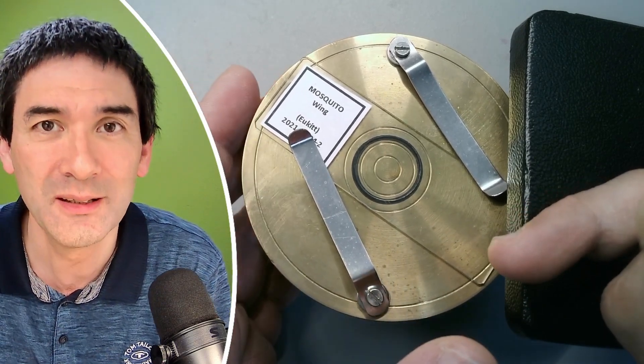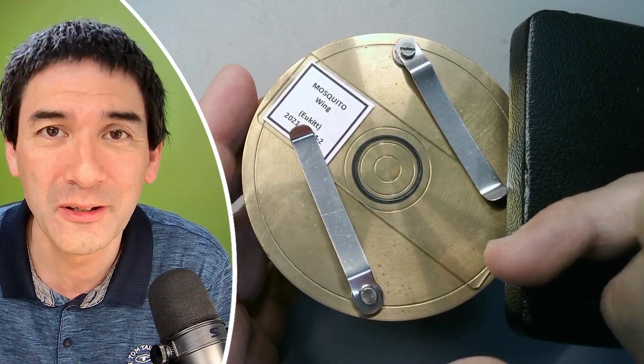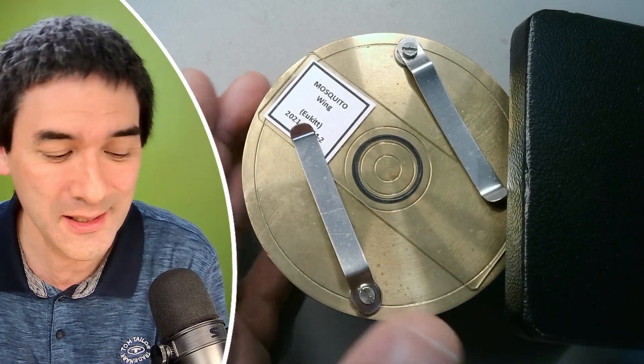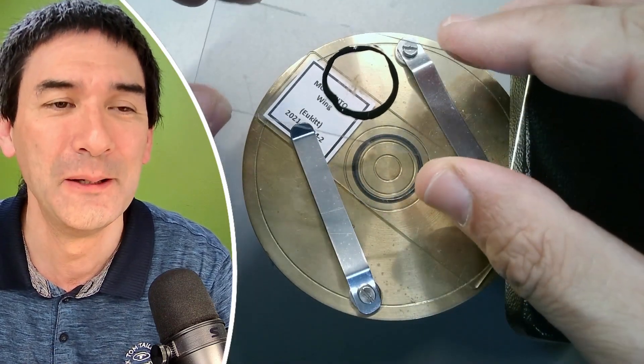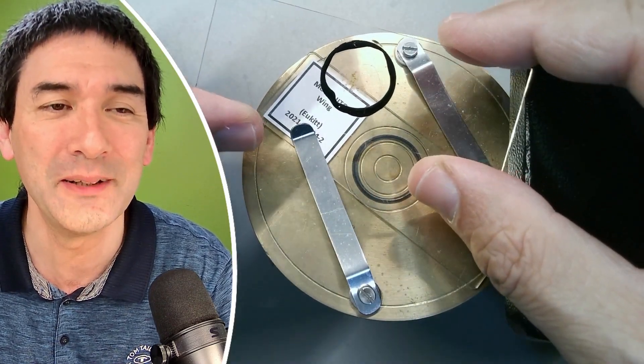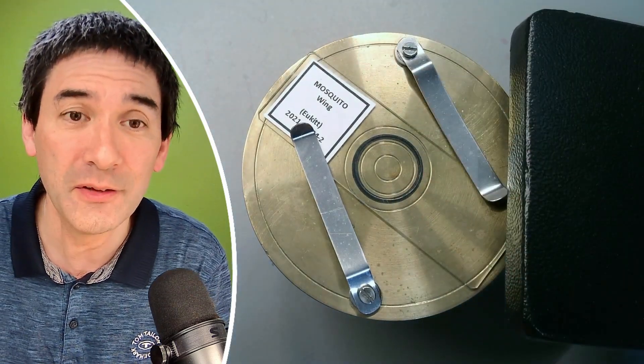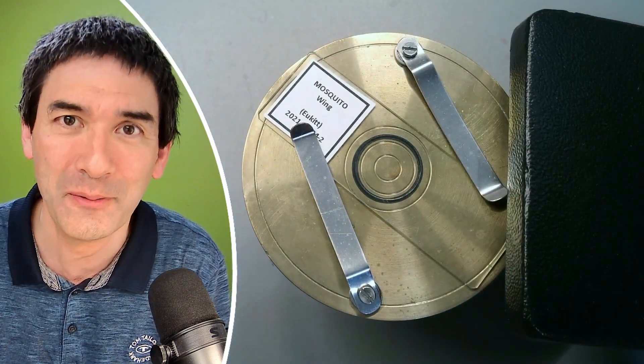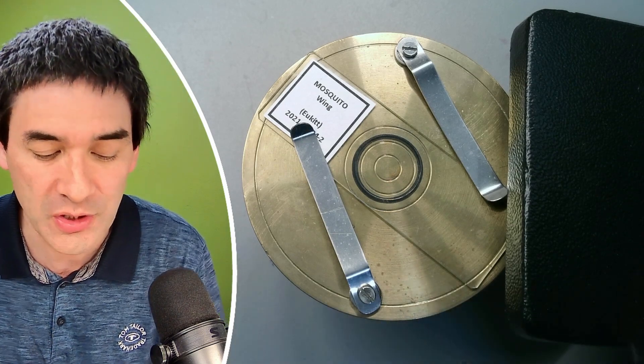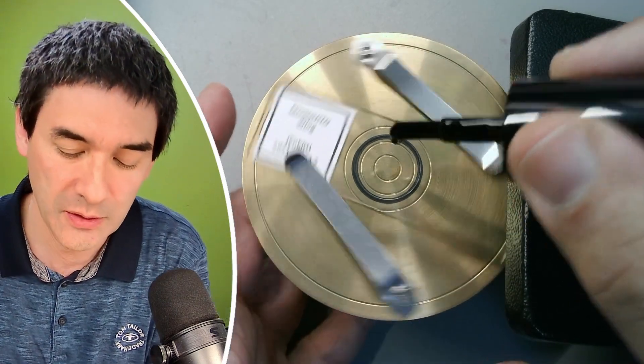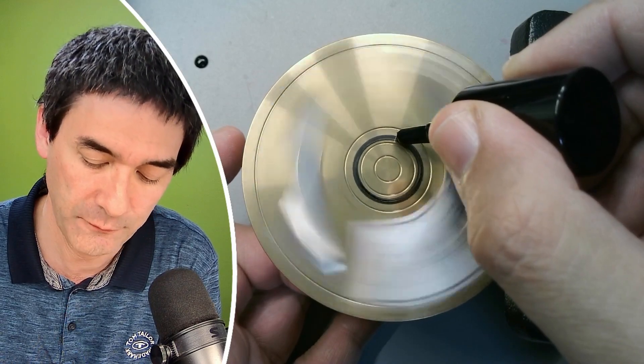However, this does take a little bit of patience and a little bit of skill because if you're not careful, then the ring is not going to look very nice. As a matter of fact, I did make a couple of other slides already before just to show you a little bit of what might happen. You see, it doesn't always look quite nice. As long as it's functional, it's going to be fine. So I'm going to give it a try in any case, and even if it doesn't work, then at least you know how it should work. You might want to use a finer brush as well, and in the past, I've also used a pipette. So, and look, it's dripping. So let's spin it, and let's carefully apply.